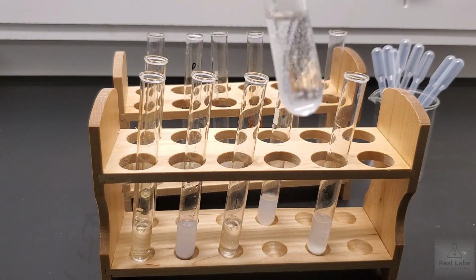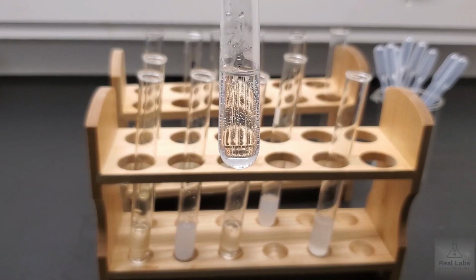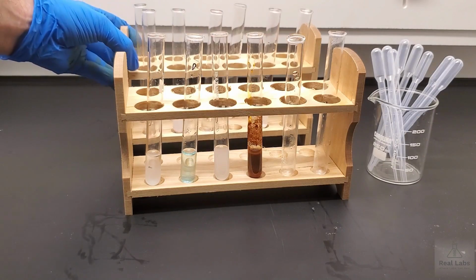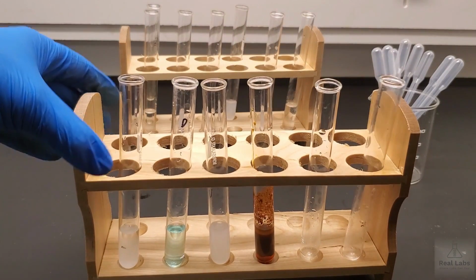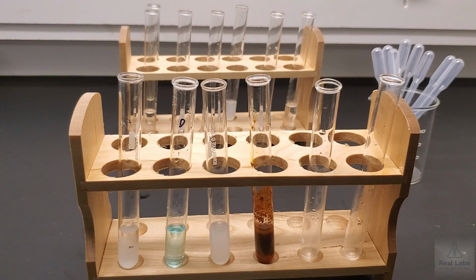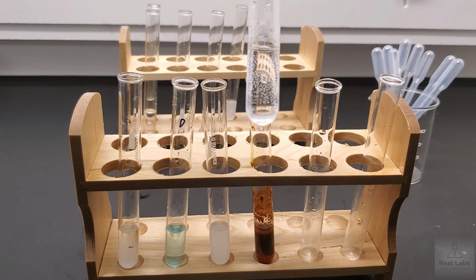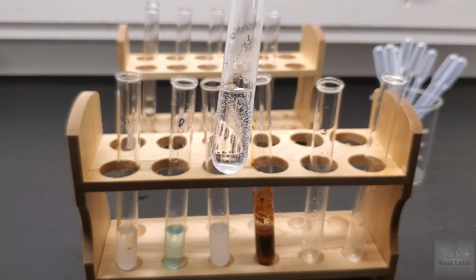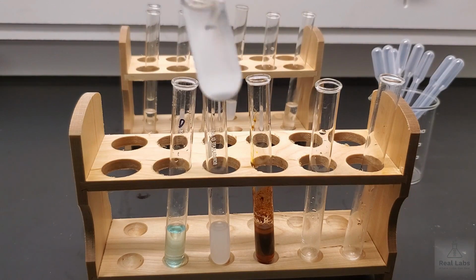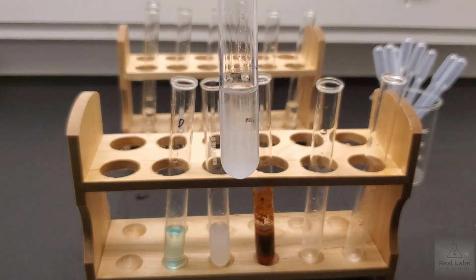Number 6, this was barium chloride and sulfuric acid. The next one we ran, I'm sorry, number 6 was not barium chloride, that was the ammonium hydroxide and sulfuric acid. So when you look at that one, just make sure you look very carefully at what you see in that. The next one we ran, again, you can see here that clearly at the bottom there's something there.